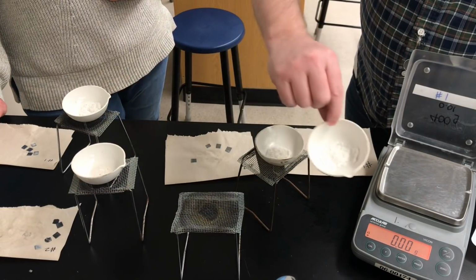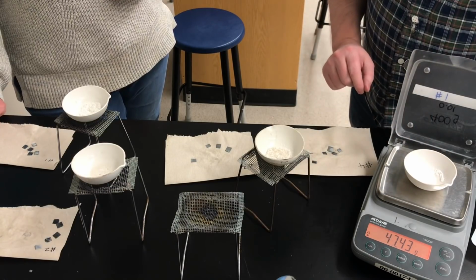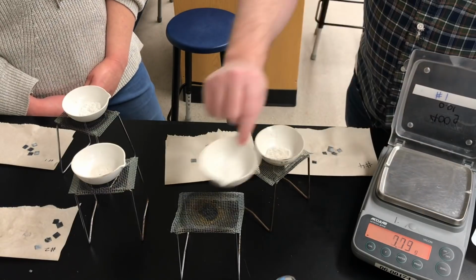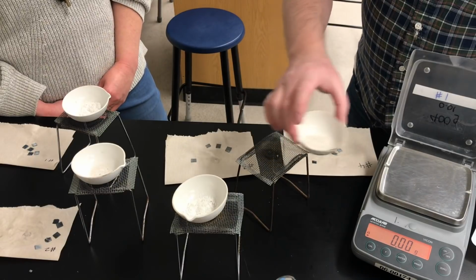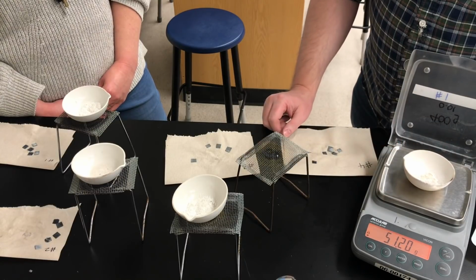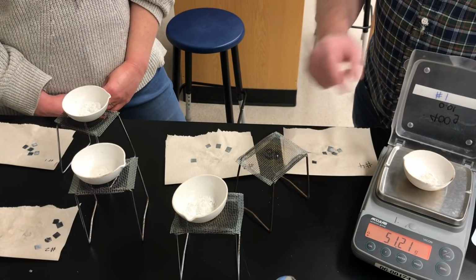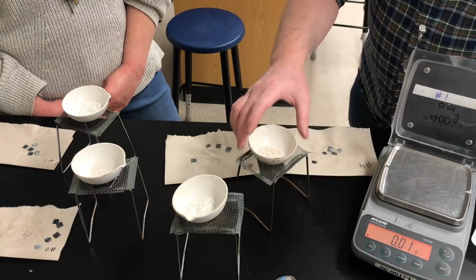The third dish with its zinc chloride solid. Now keep in mind that if we didn't heat long enough, then there would still be water present in the dishes, and that would mean our mass of zinc chloride would have been too high because we'd be measuring some water as well. But we're pretty sure we heated these all to dryness. So there's the 4th dish with its mass of zinc chloride inside.